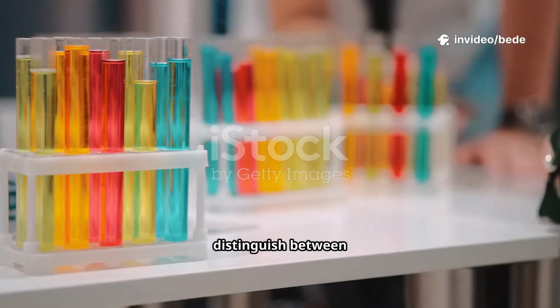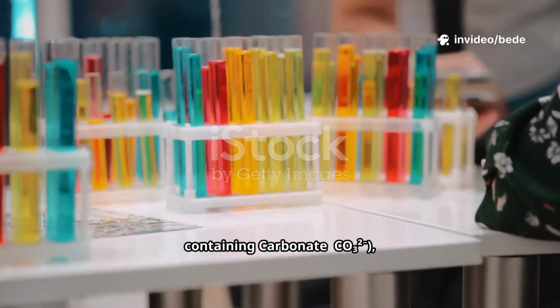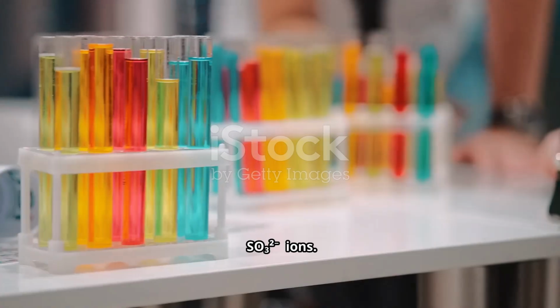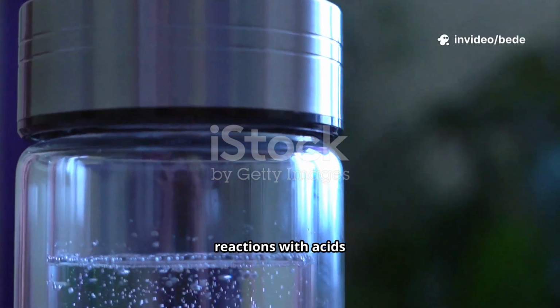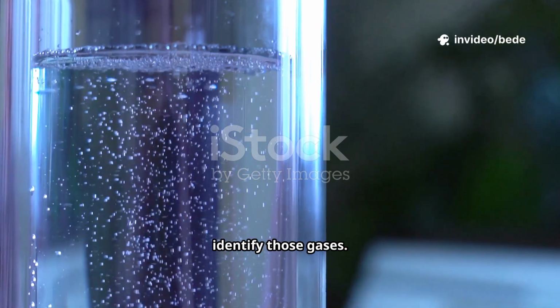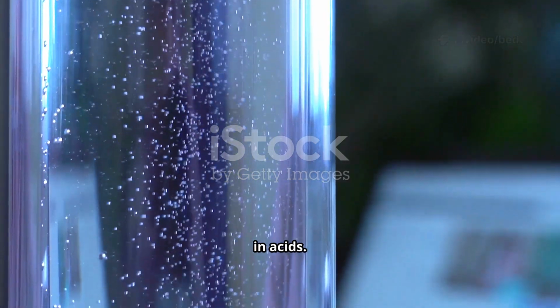Objective: to identify and distinguish between aqueous solutions or solid samples containing carbonate, CO3^2-, sulphate, SO4^2-, and sulphite, SO3^2- ions. Key principle: we will use their reactions with acids to produce different gases and then use specific tests to identify those gases. We will also use the solubility of their barium salts in acids.